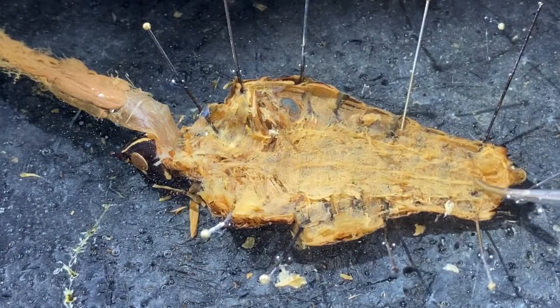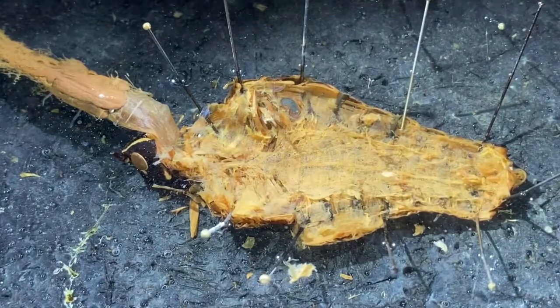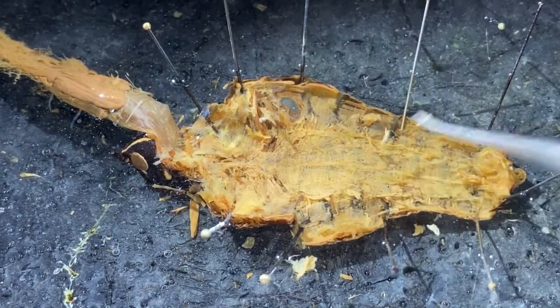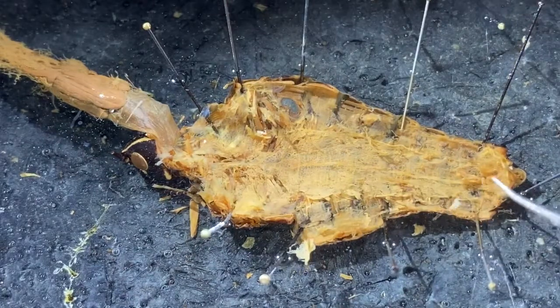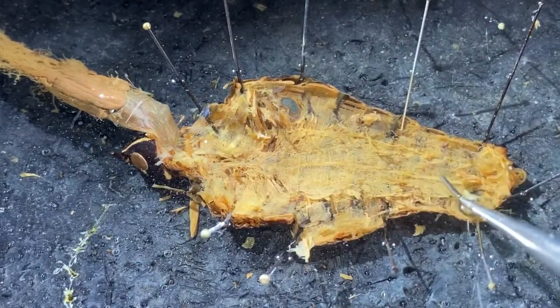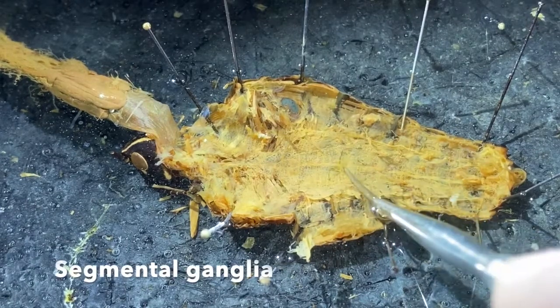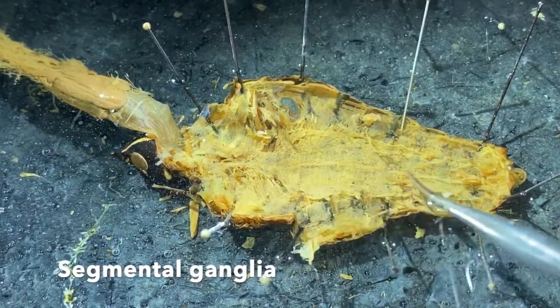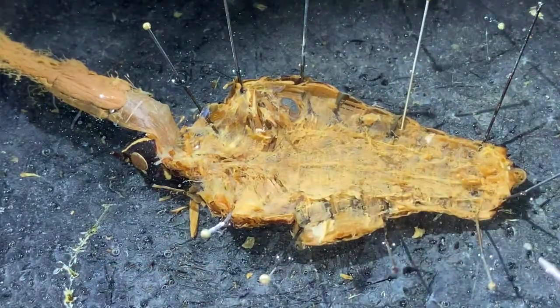And it's still covered by a layer of peritoneum, so it's a little bit tough to see, but you can clearly see that this structure runs the length of the body, and there are segmental ganglia down in there, these slight little bulges that you see here and there. Again, they're a little bit tough to make out through this peritoneum, but you can see the ventral nerve cord running the length of the body.